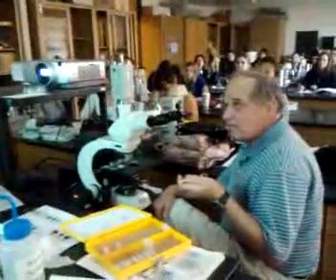Yes, ma'am. I will point. Say I put the pointer in a space like that: identify the sac-like structure, or what is this? I don't remember how I have it worded on the test. But see all of these, like if I switch my pointer right down there. Any of these things are alveoli, or actually the singular is alveolus. But there it is, right there.